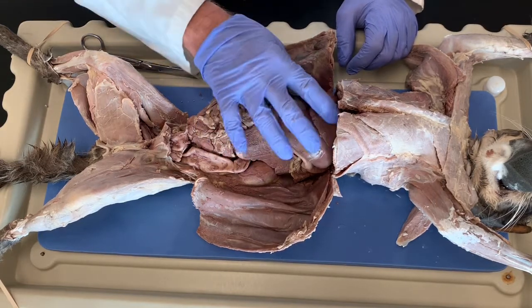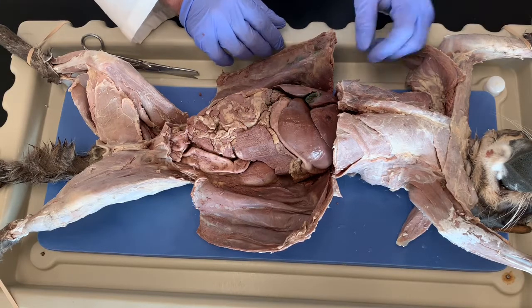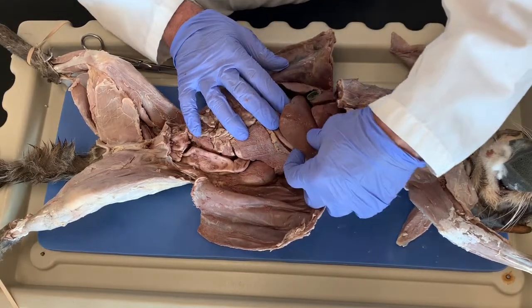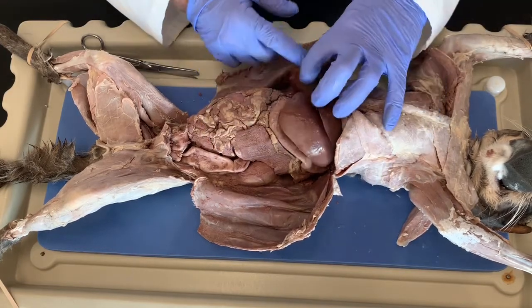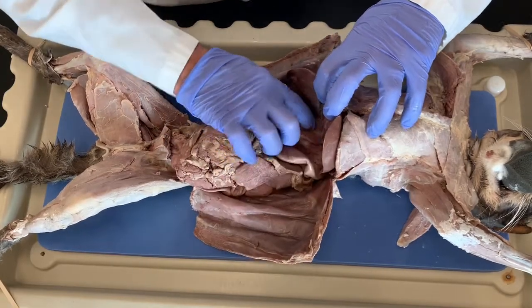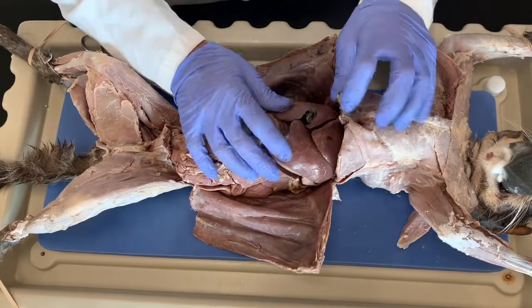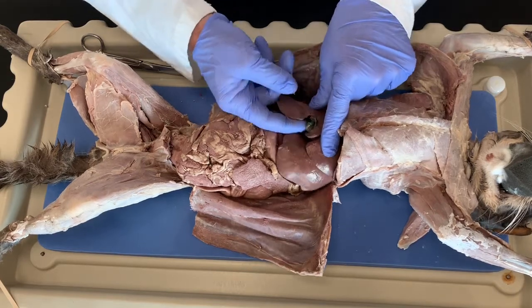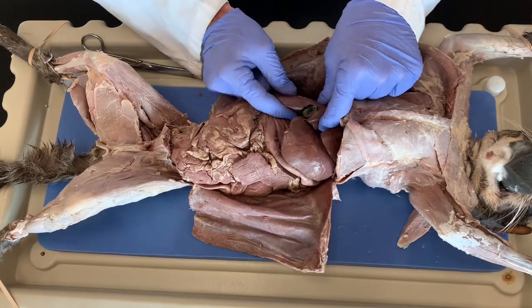Here, these structures right here are the liver, and there's actually 5 liver lobes in the cat. Okay, this is the cat's left, right? So this is going to be the left lateral liver lobe. This is the left medial, right lateral down here, and then the caudate lobe is underneath right there. Okay, and then we know this is the right medial liver lobe because of this structure right here, which is the gallbladder. Okay, the gallbladder is kind of encapsulated by the liver.